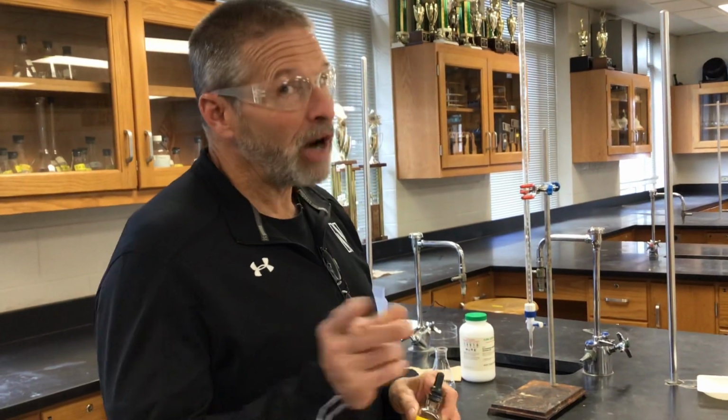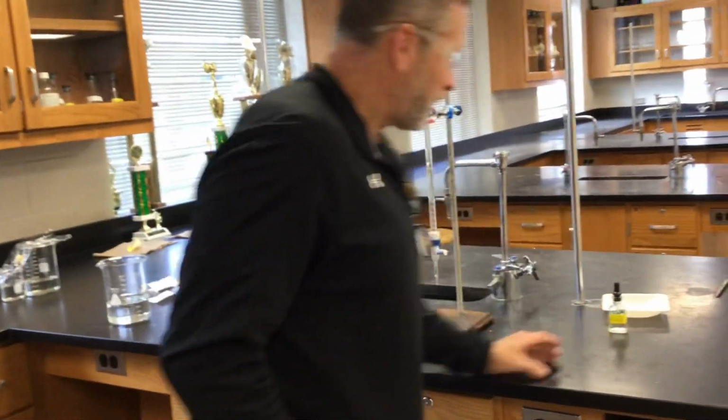Not dropping the base. Okay, standardizing the base.